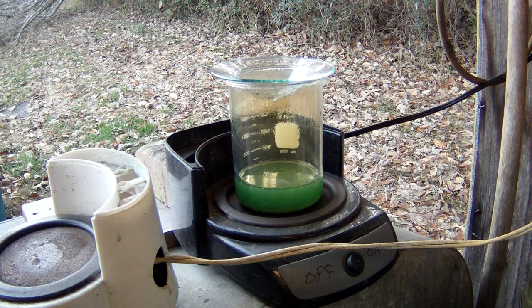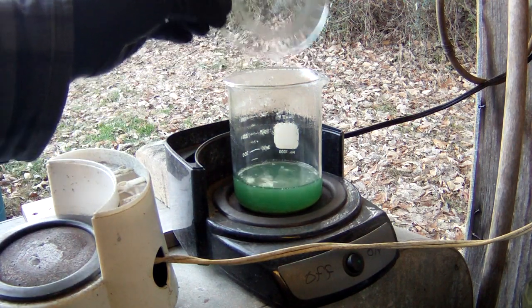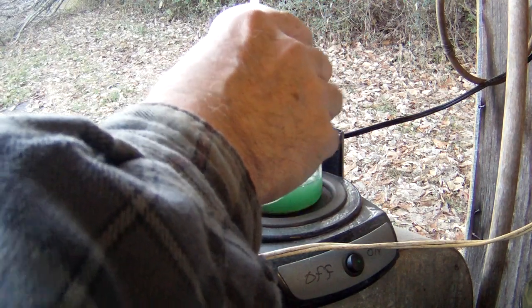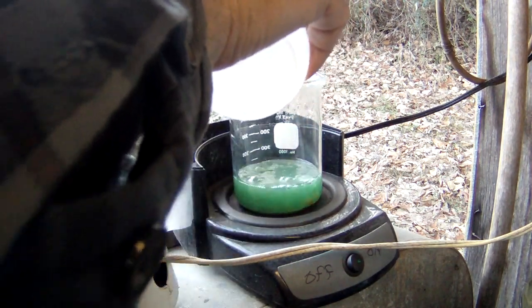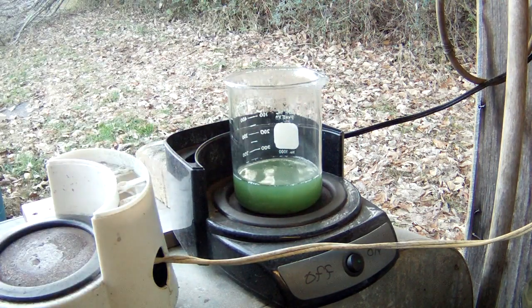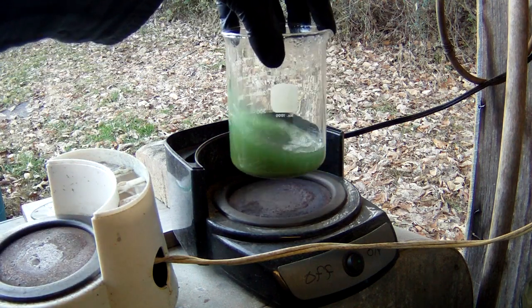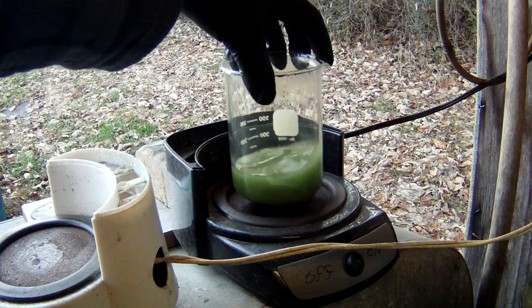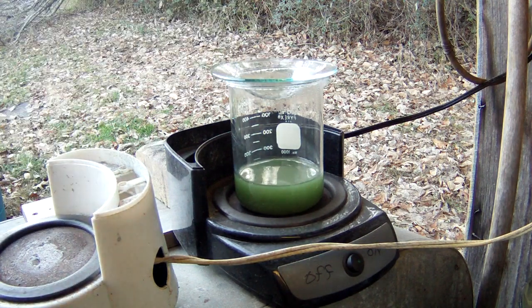Okay guys, we're back again. I'm just going to add a little bit of distilled water to this, just in case we're getting saturated, and I just want to make sure that the silver that's coming off of these has a place to go, because we still have some action going on. So we're actually going to rinse this down a little bit, give it a little bit of water so it's got somewhere to go, just in case. We're still getting a pretty fair little reaction. I mean, it's not blowing out of the container, but we'll just let her go. Alrighty, back at you in a bit.